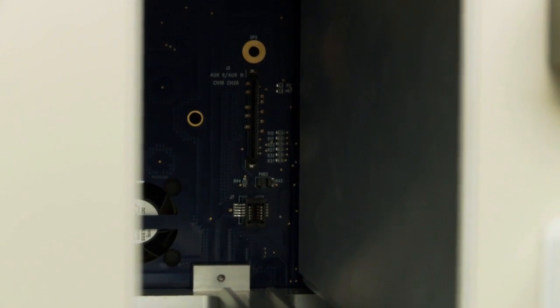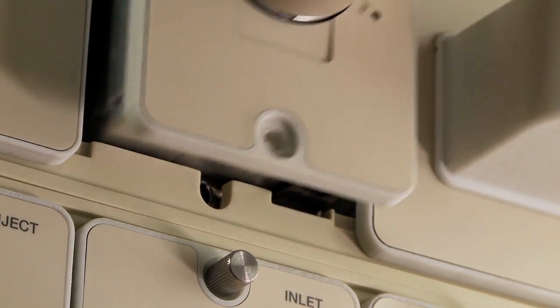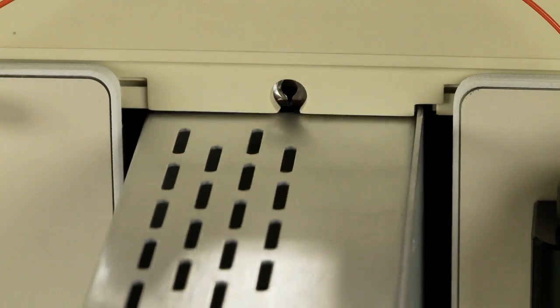Slide the module into the open bay until it is seated on the main communication board. The module is self-aligning, so you should feel the module lock into place.